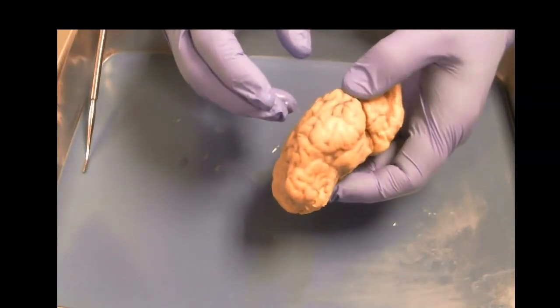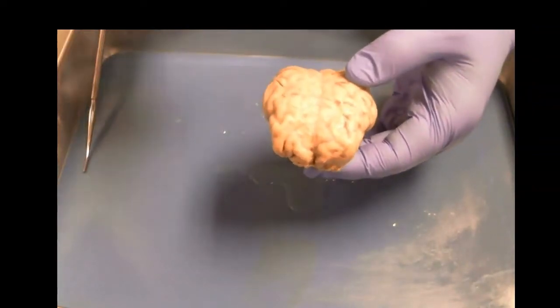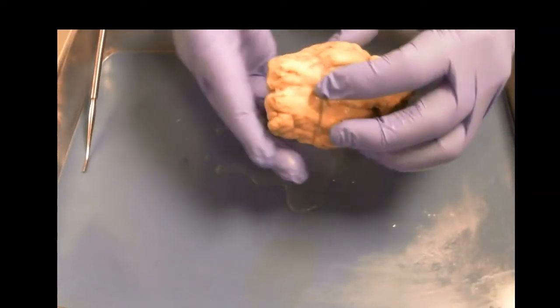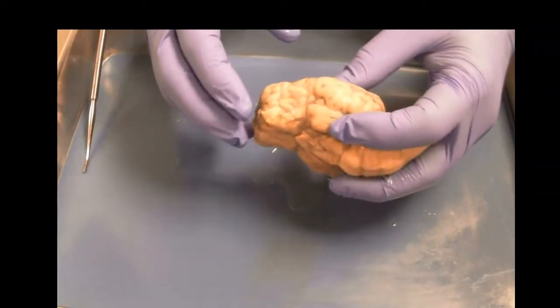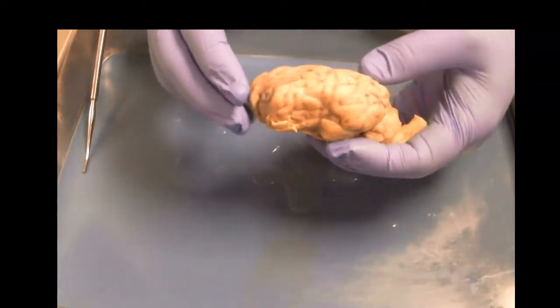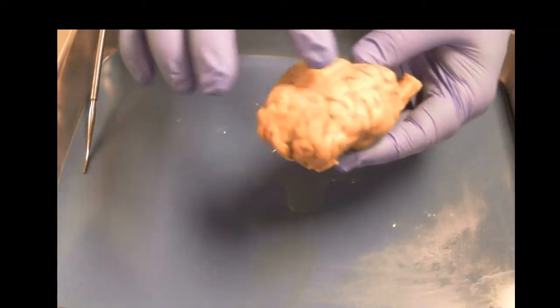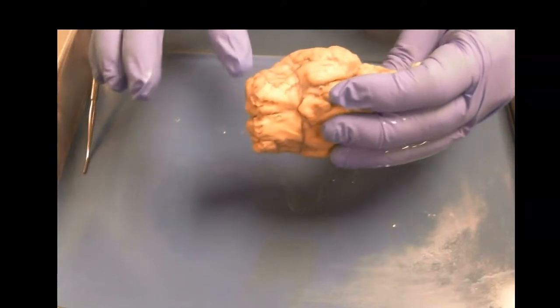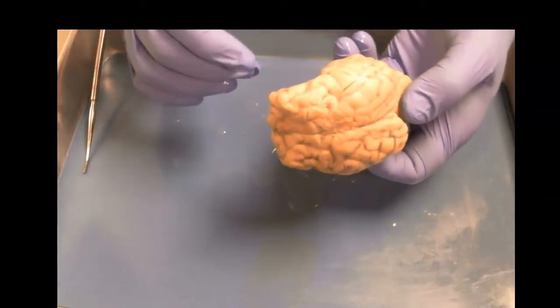Now, we look at the surface, and it's wildly different than a human brain in terms of size and structure. Humans have one of the largest brain-to-body ratios on the planet. Here's the frontal lobe area, right? This part here. Parietal lobe is back here. Occipital lobe, where we expect it. And then our temporal lobe is this little tiny piece here. Temporal lobe in the sheep's brain is heavily taken up by the hippocampus.